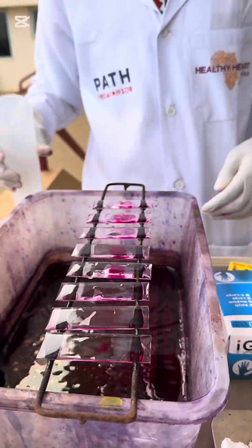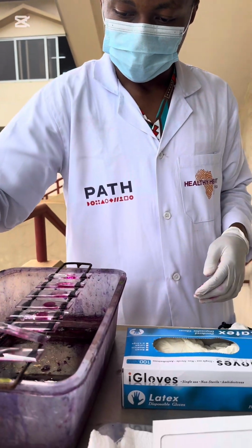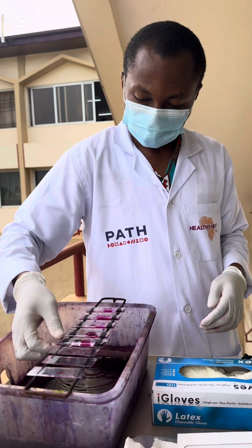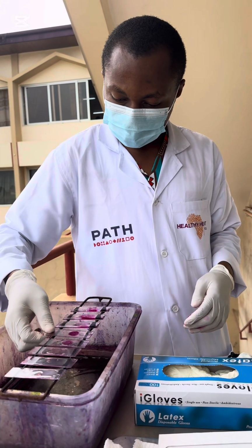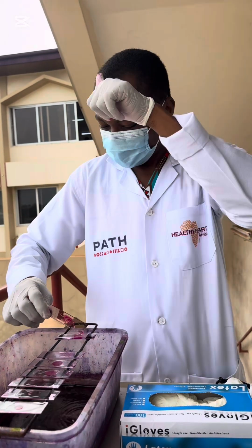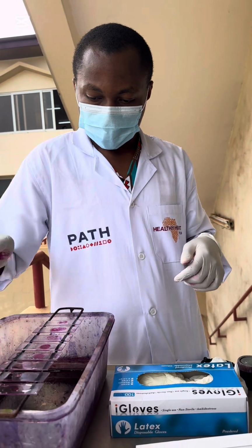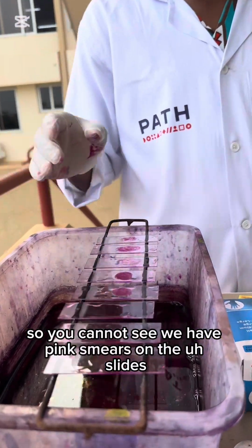Alright, so we're able to wash our slides very well. So let's get rid of the excess water. Alright, so you can now see we have pink smears on our slides.